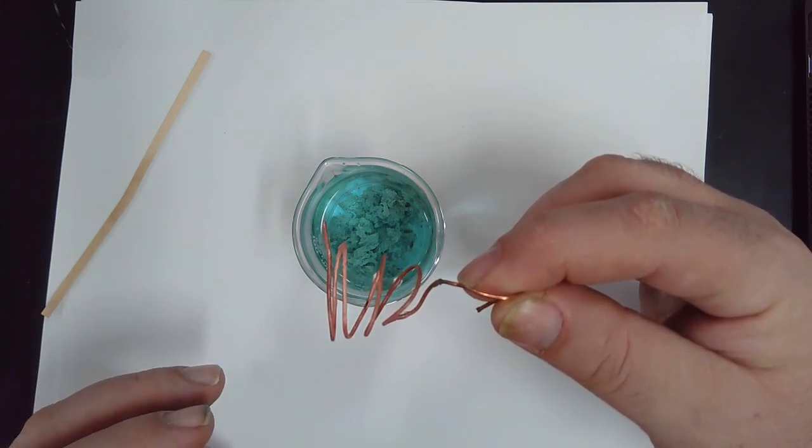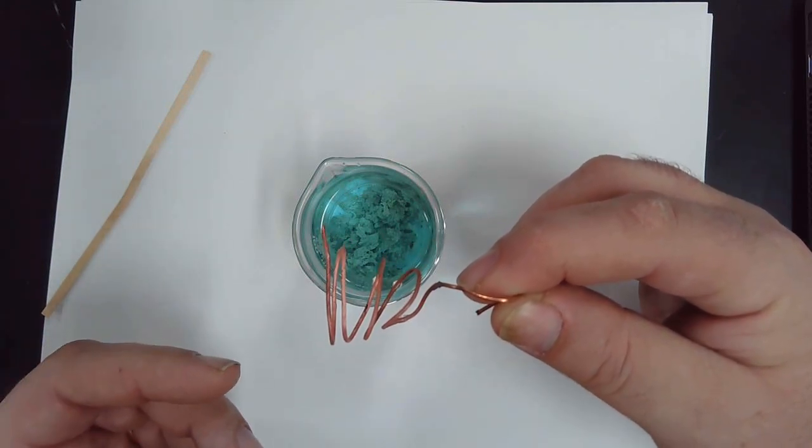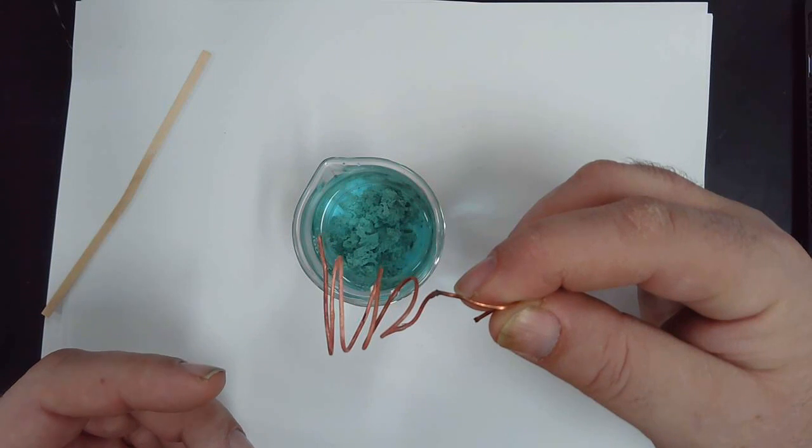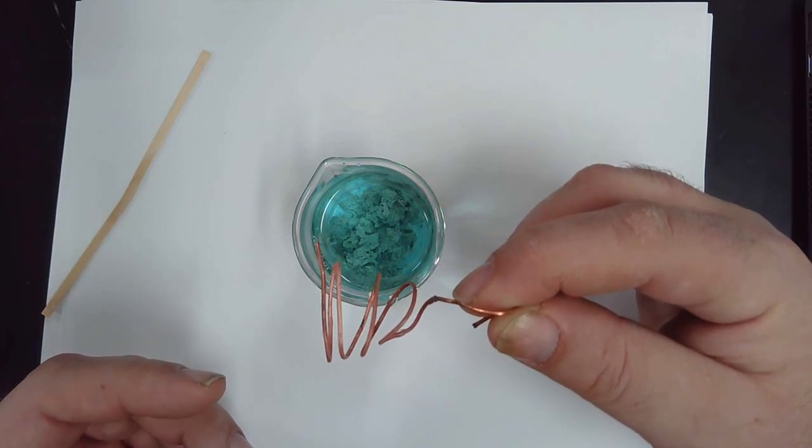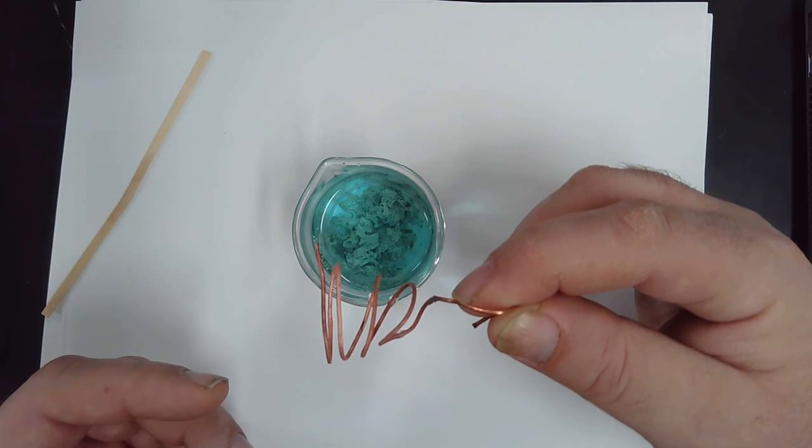The acetone will connect to the water and evaporate rapidly, therefore leaving the copper completely dry. It takes all the water out of the nooks and crannies so it'll be completely dry. When that happens, you'll be able to get a clean mass of the copper that's remaining. You need that mass for today. Does everybody understand that?